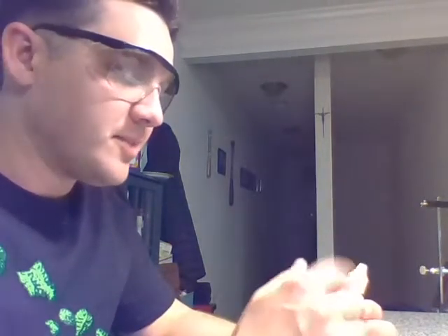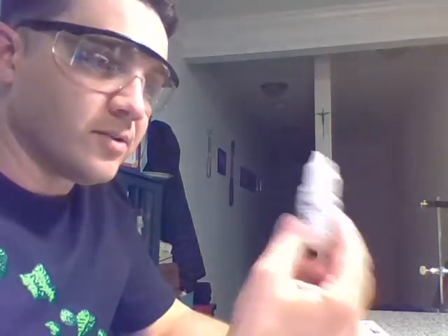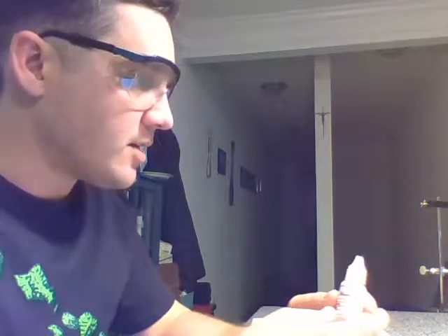So I did a walkthrough of the lab, set everything up and walked through it just to make sure I got everything I need, and how I'm going to attempt this experiment, so that if I need something else, I've got it. But I'm curious to know how I'm going to be able to dip the inoculating loop inside here. There's an opening at the top, but it's not large enough for the loop to fit down in there. So I may have to actually drip it down on there. I have some paper towels standing by to do that.